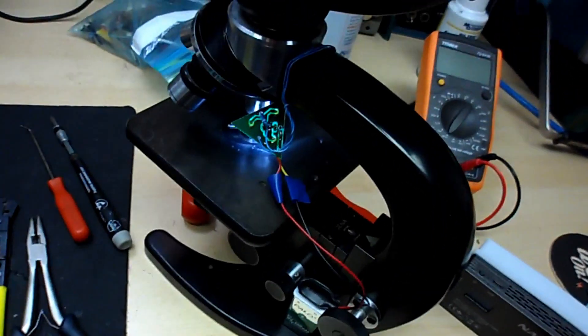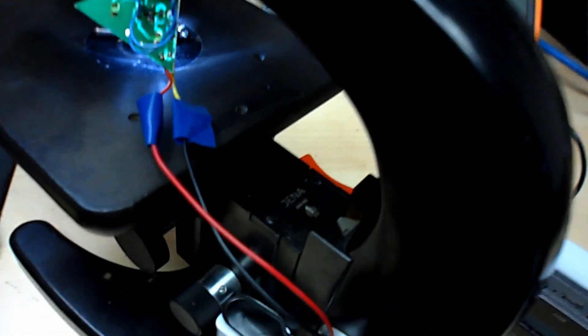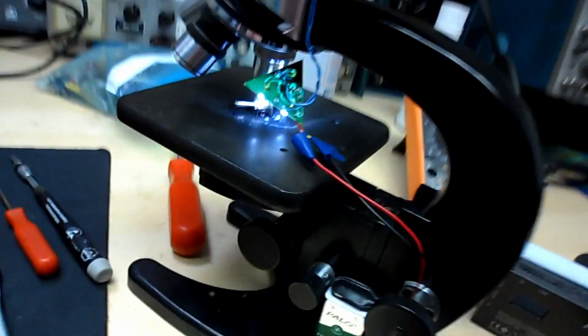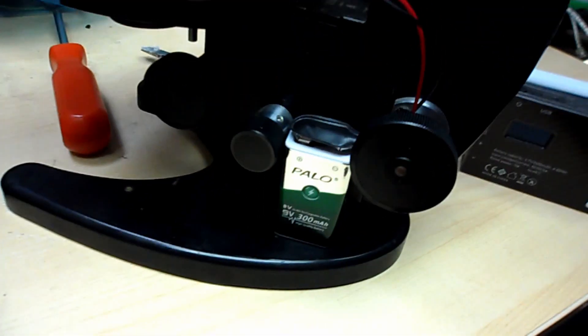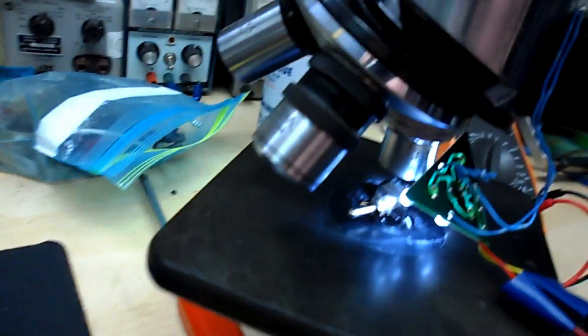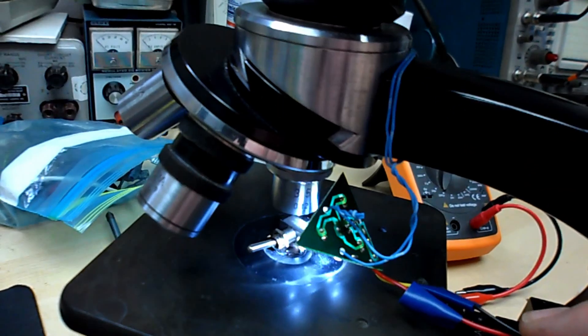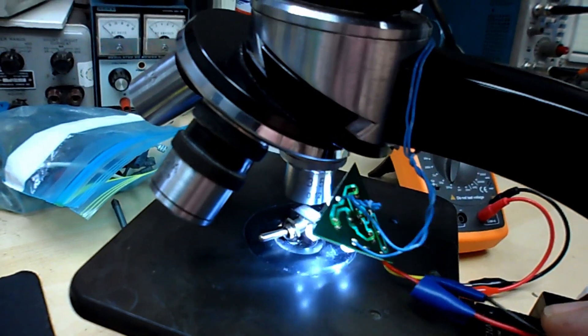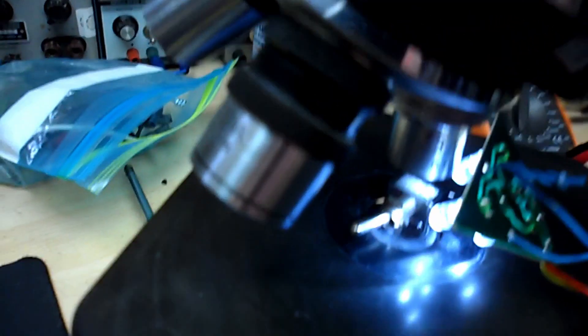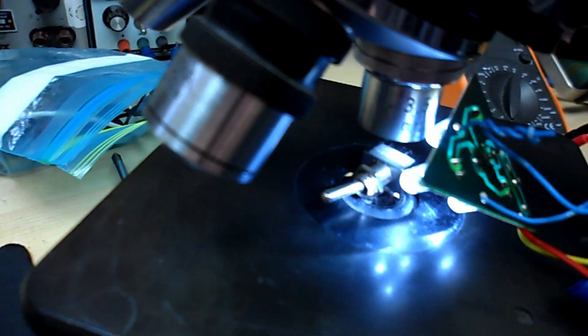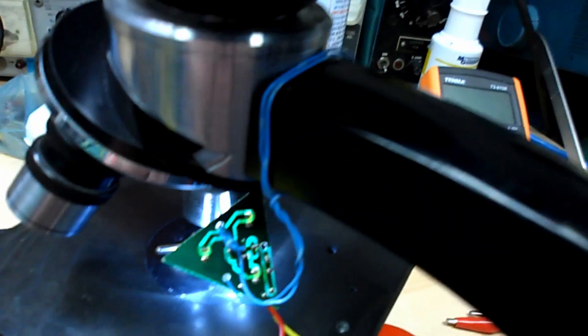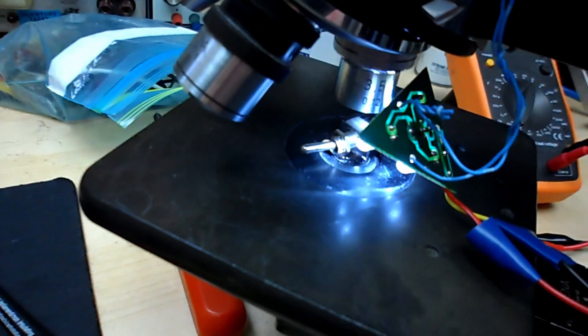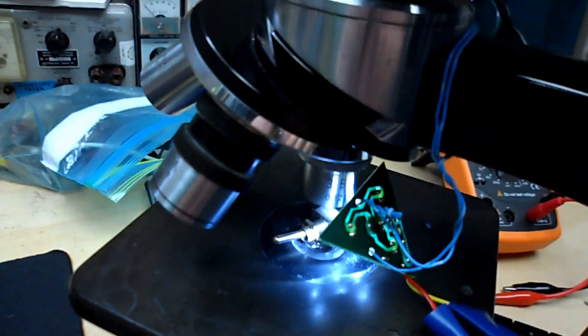This is a follow-up video to the other video I did on this microscope. In the last video I added this light to it. You can see a little switch just sitting there under the light. It just runs off a nine volt battery, very simple, just suspended with some wire. It's crude but it does work.